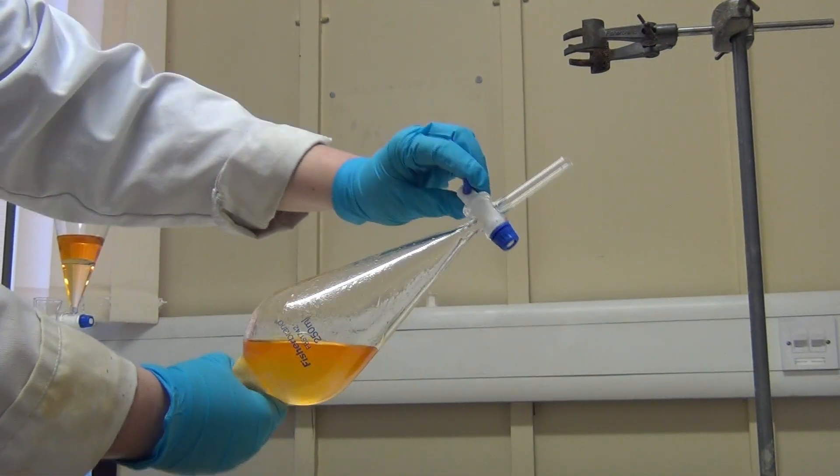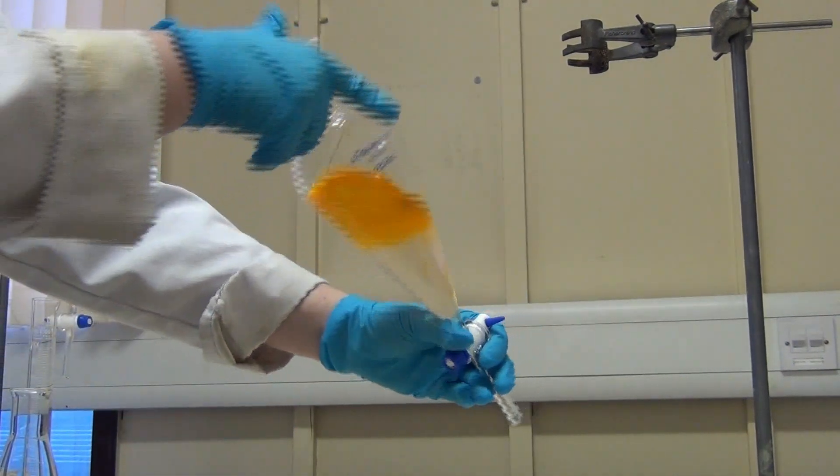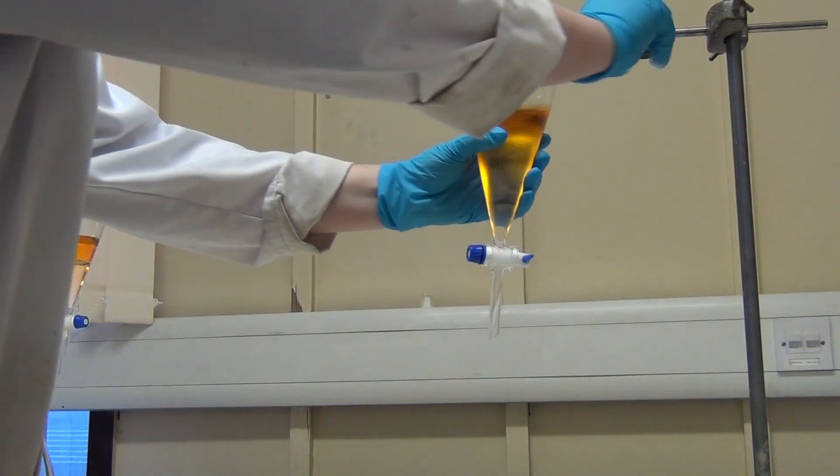Then securely attach the separating funnel back in the clamp or ring, and watch the layers begin to separate.